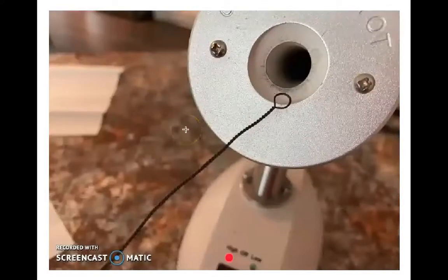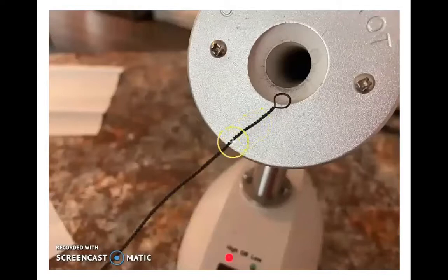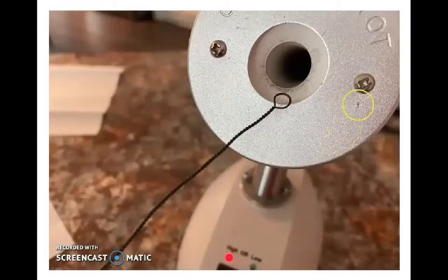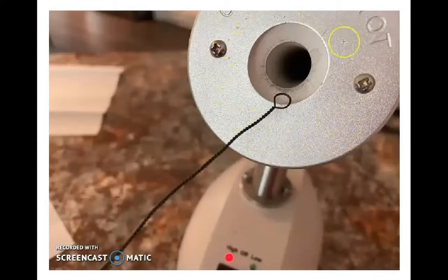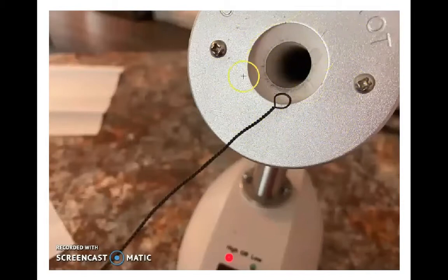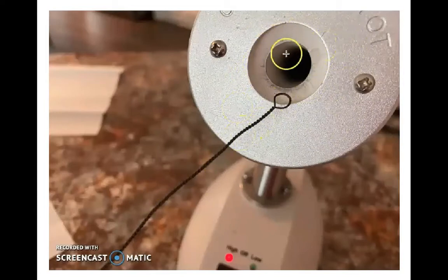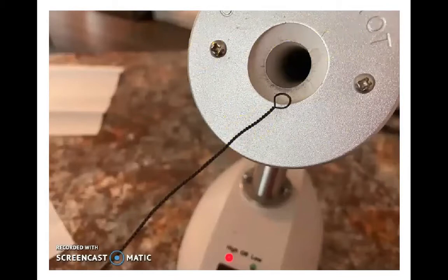When ready to sterilize the loop, it's the wire portion — not the aluminum handle — that we put into the incinerator. There's a metal plate on the front of the incinerator and a ceramic tube running down into the device. We place the wire as far as it will go down into that tube for sterilization.